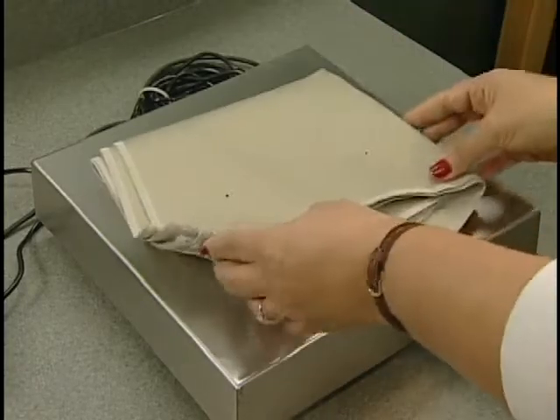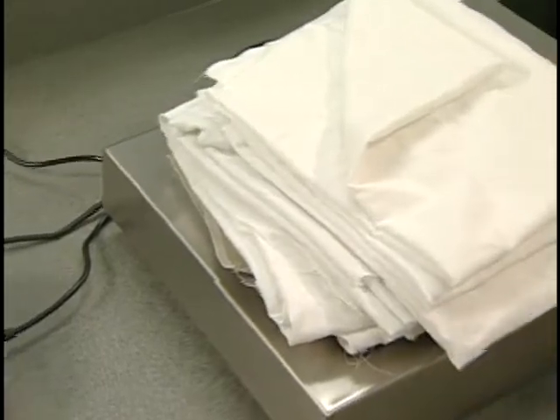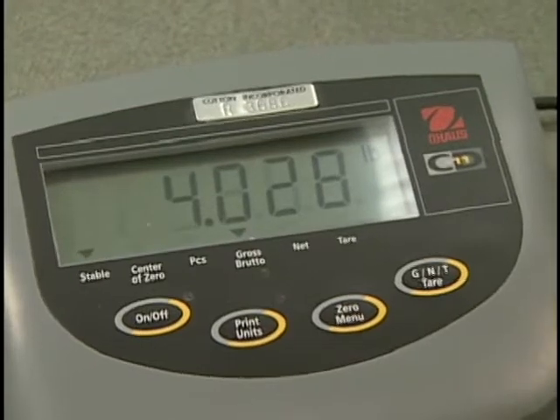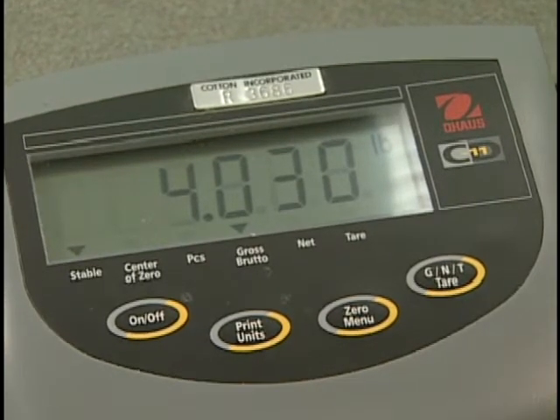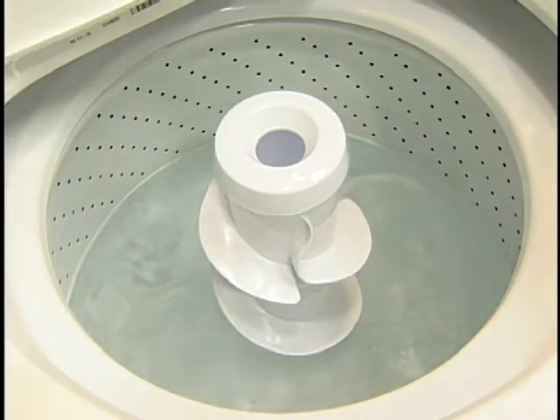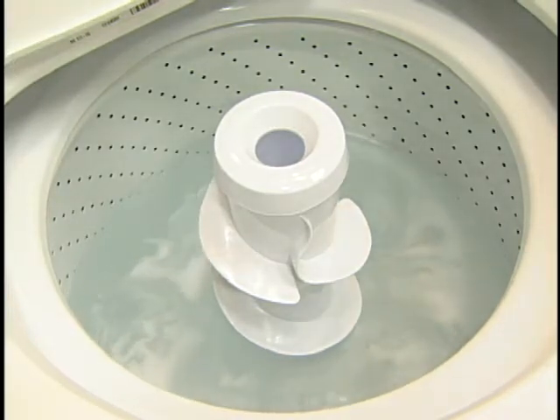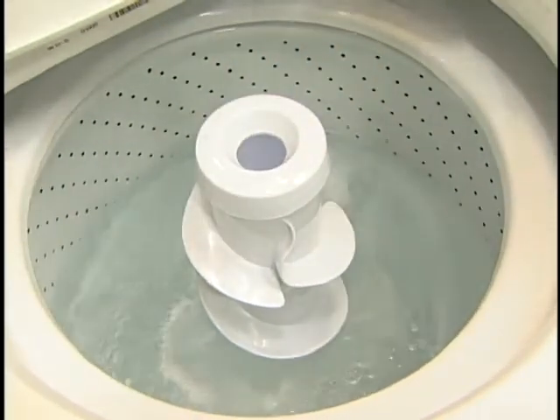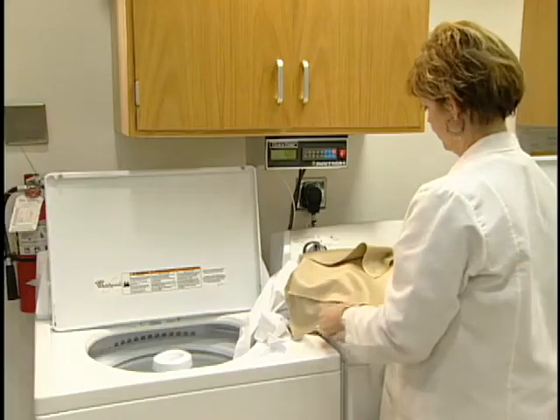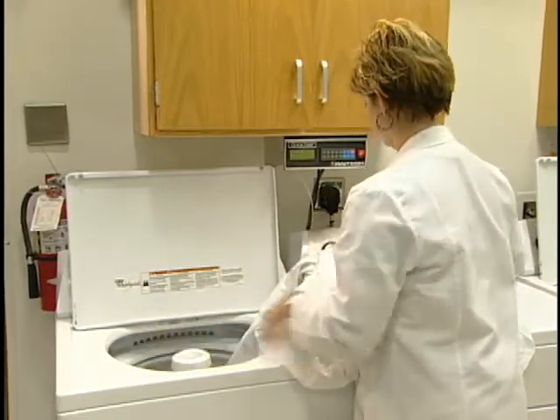The prepared specimens are washed to the standard in a load size of 4 pounds, 1.8 kilograms, including any ballast needed. Sets of three specimens are weighed along with the ballast. Ballast for the wash loads is clearly specified as to size and fabric type. The washer is filled with 18 gallons of water at the specified temperature. The water temperature can be measured by hand or controlled by a microprocessor that automatically blends hot and cold water to the desired temperature. The detergent is added while the washer is filled with water, followed by the specimens and proper ballast.